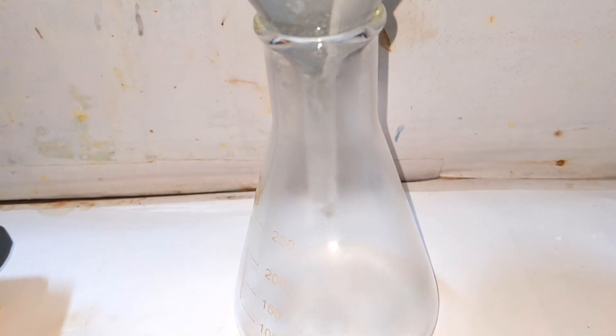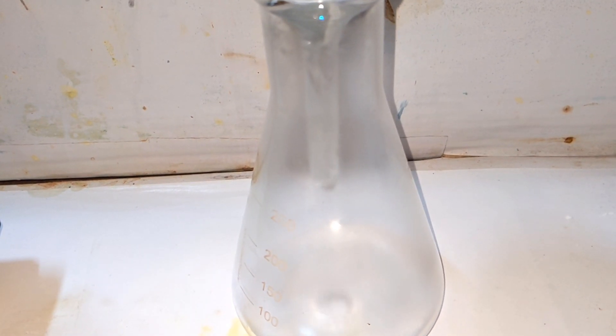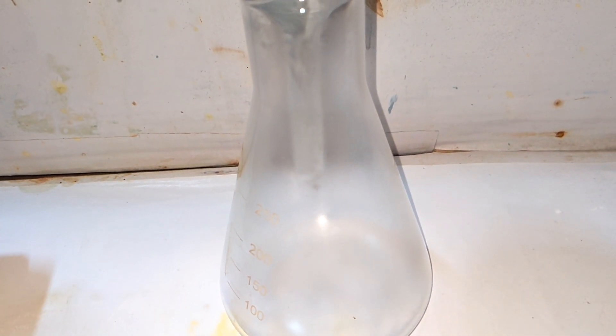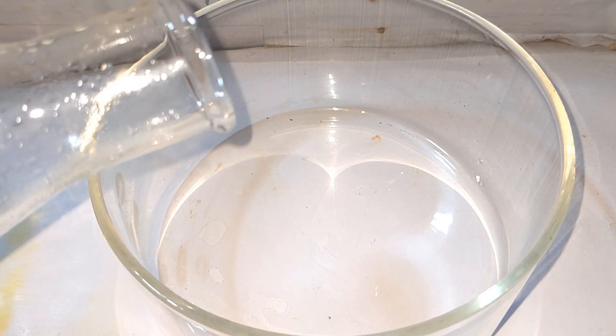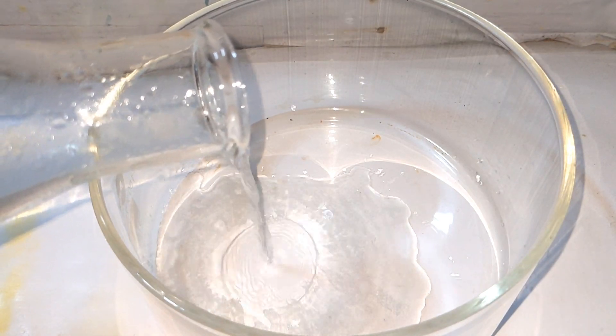Finally, the solution is filtered and the clear filtrate is collected and it was then poured onto a large crystallizing dish and was allowed to evaporate over time.